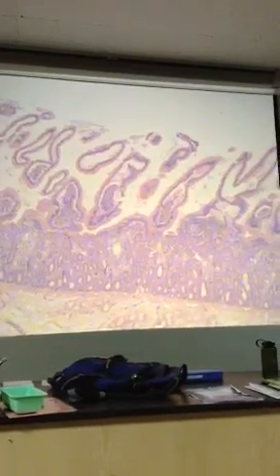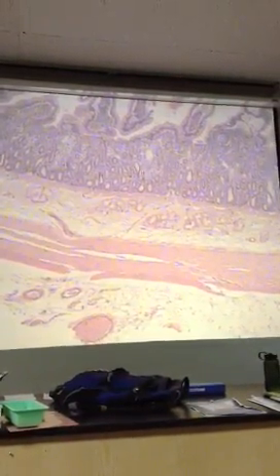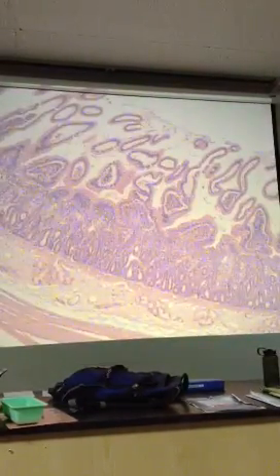And so when it comes to the intestines, you have the plica or plicae circularis. That's the same thing. It just means a circular fold. And that's also a macroscopic structure. I mean, it's not apparent here. I see it goes down a little bit right there, just kind of overall. If you held it up to the light, it might look a little bit like a wave, depending on which slide you got. You may or may not have seen a plica. But that's a macroscopic structure. I won't test you on that.